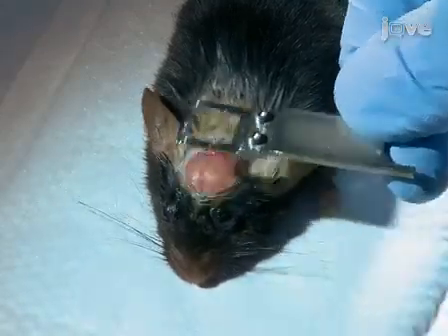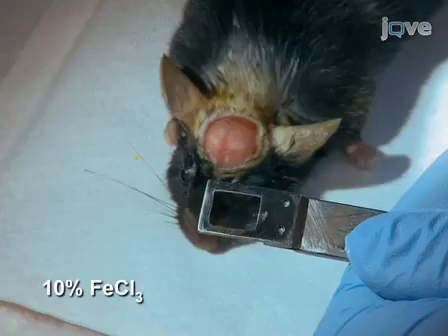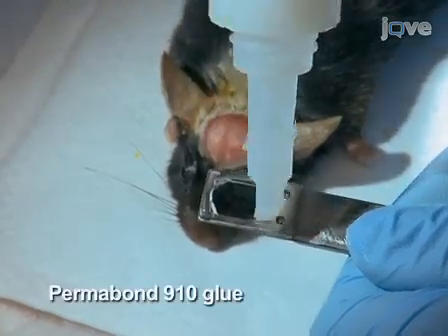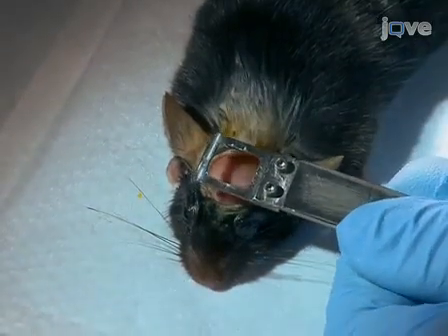Then, again using a cotton swab, dry the skull using a 10% solution of ferric chloride. Place a thin layer of the Permabond 910 glue around the edges of the viewing window underneath the head plate. Then place the plate over the area of interest on the animal's skull with light pressure.